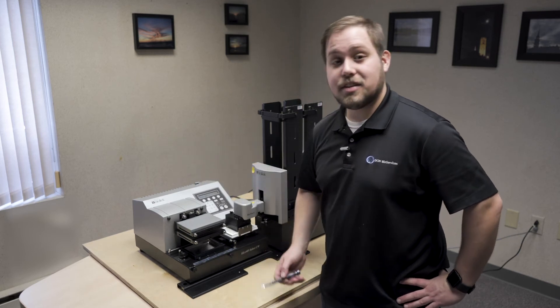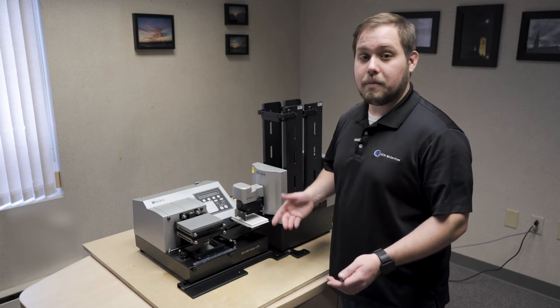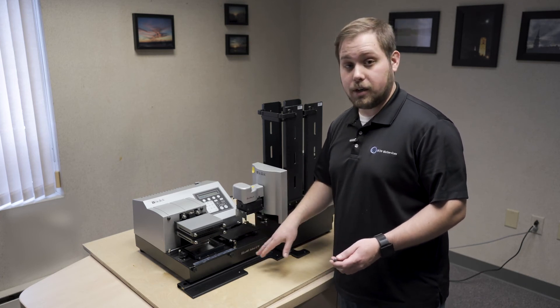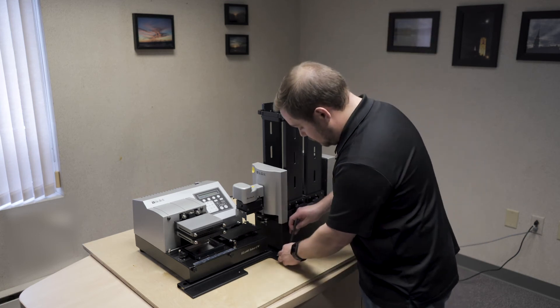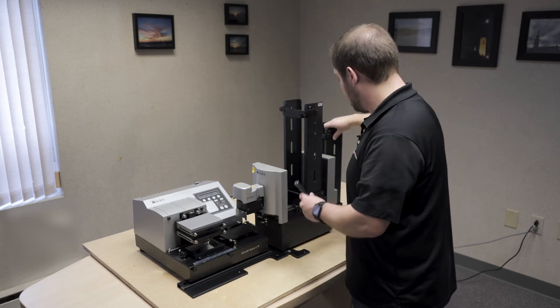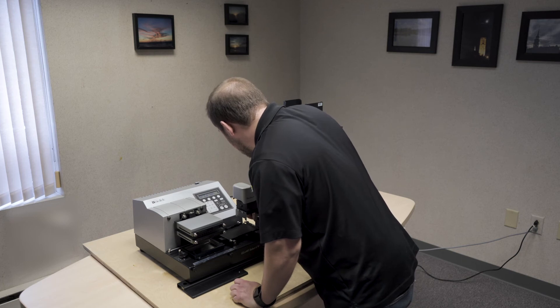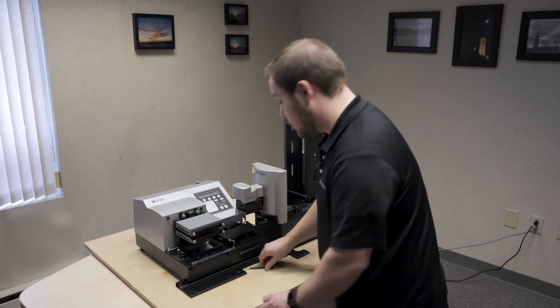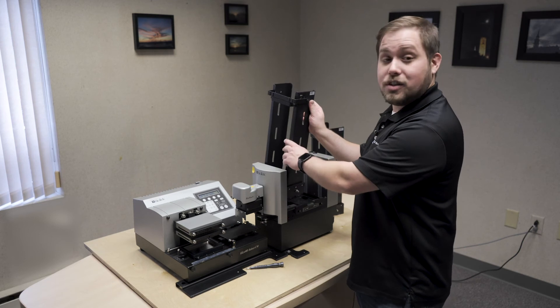Excellent. At this step, we're ready to lock down the mounting plate. The two flathead screws on either side of the biostack will hold that plate relative to the washer's plate. This will keep everything from shifting around and hold our saved position. Once the plate is secured in place, it's a good idea to run one more verify, just to make sure that you didn't shift anything around.